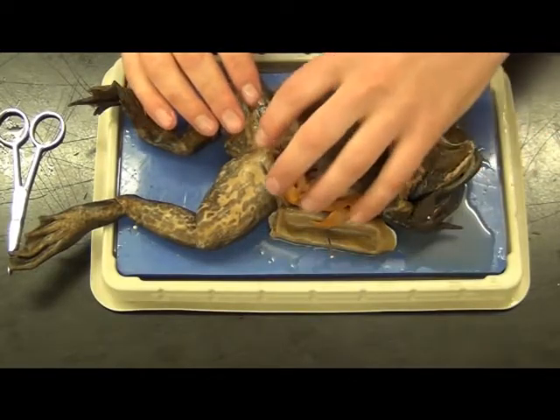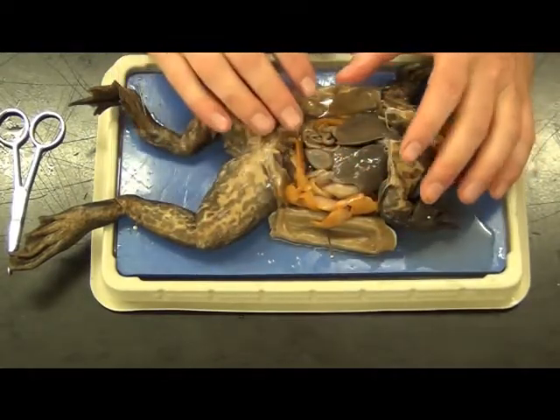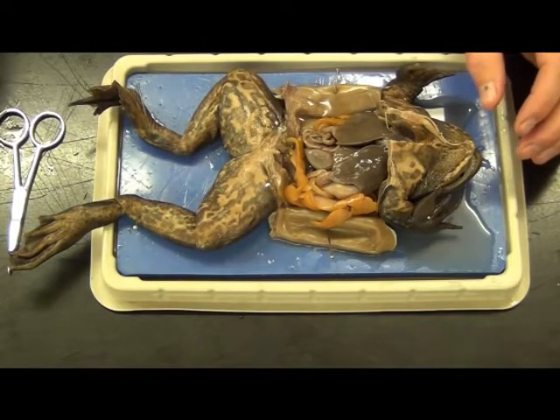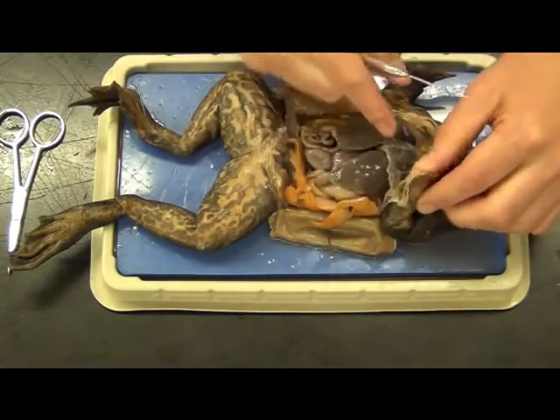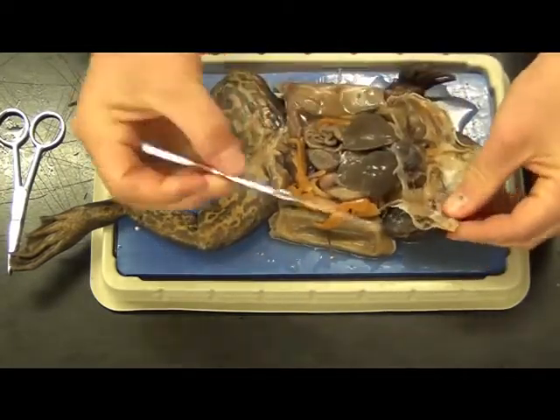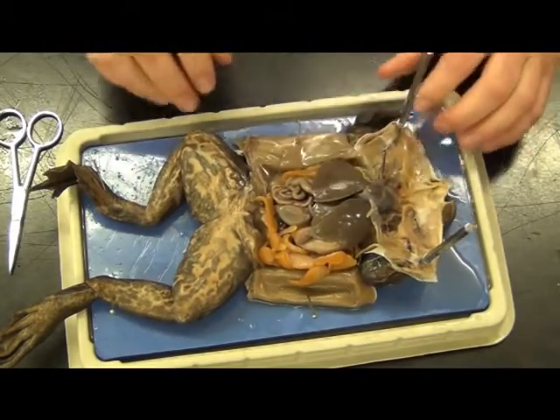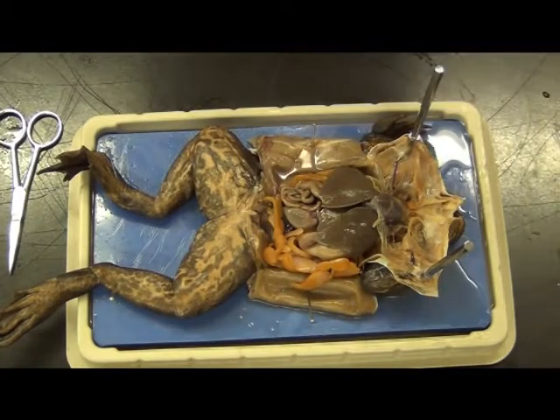A lot of times when you open this up and it's a female, quite literally it looks like large grains of salt and pepper covering the entire cavity — eggs will be everywhere. But no eggs here, so I'm going to stick with thinking this is a male. I'm also going to open up the front, pull the two halves back, and use my probes to spike in and open this area. This gives me a wider field of view when I do the dissection. At this point, we are ready to start looking at the internal organs.